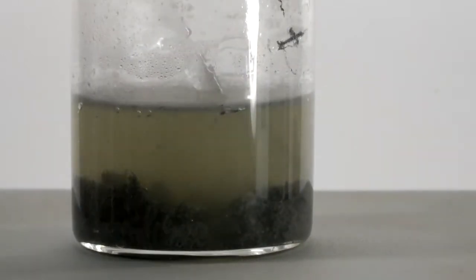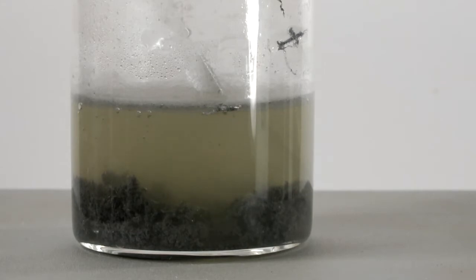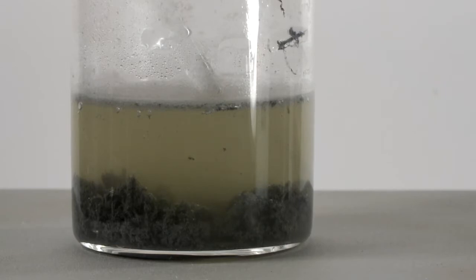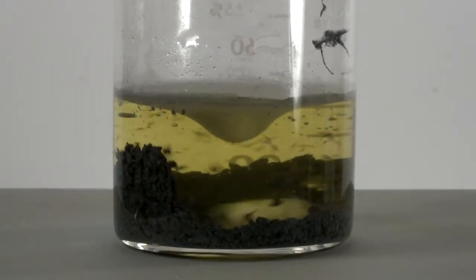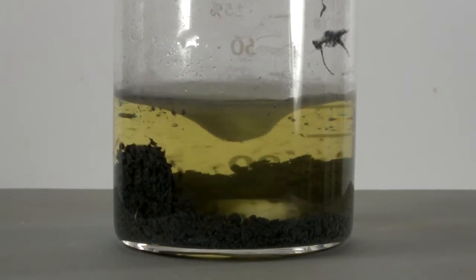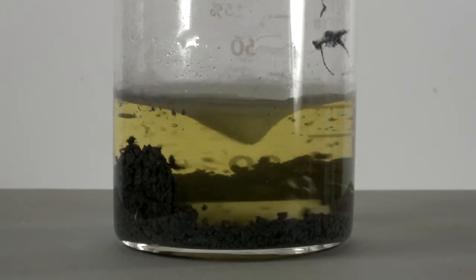And what happened is we get this murky colored solution, and all the lead, now metal, has fallen to the bottom of the beaker. You can still see some chunks of magnesium and aluminum floating around, so since this is just for fun, I'm going to see if I can get rid of them. Now that I have it stirring, you can see the little bits of magnesium aluminum alloy still floating around in there, a lot clearer.